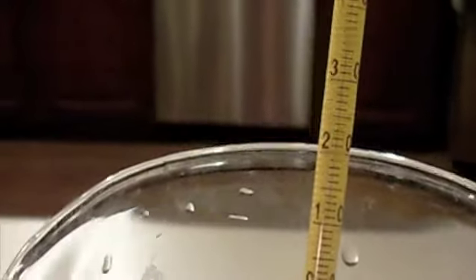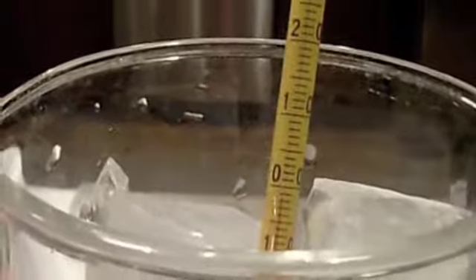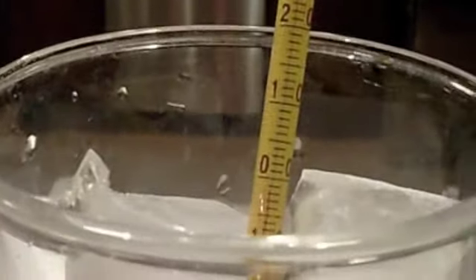Third thing, I will be recording the ice melting, and you will need to read and record the temperature. So every minute, I'm going to pause the video. I'll come back on the next minute, and then I'm going to show you the temperature. You need to record this temperature along with the minute and the state of matter in your science journal on your data table. I will tell you the minute. I will not tell you the temperature. You're going to have to read and record that on your own.